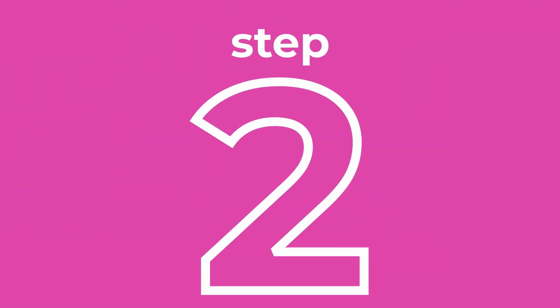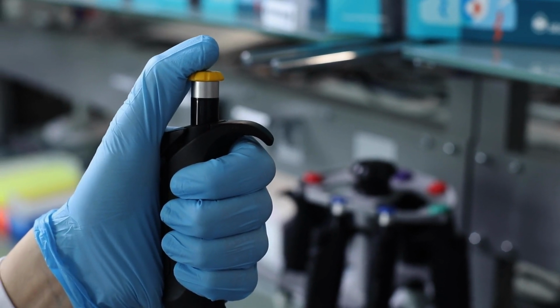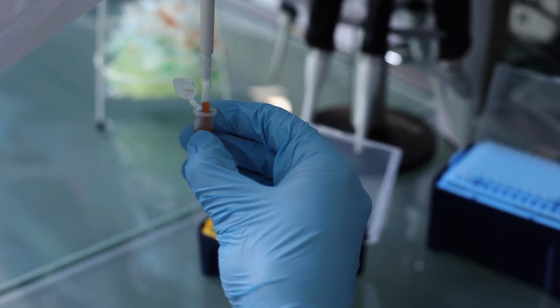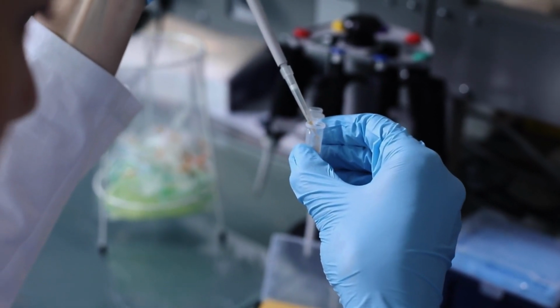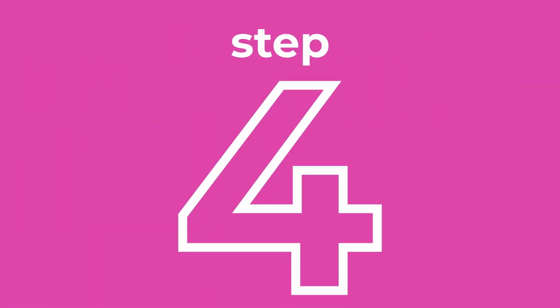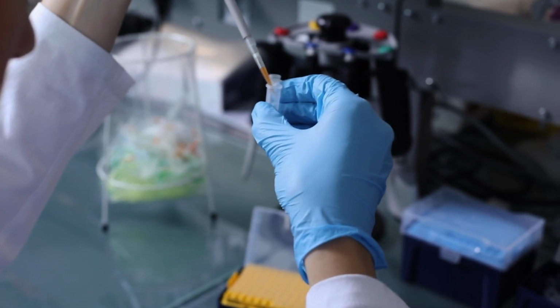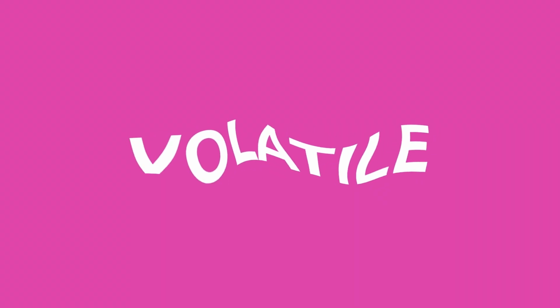Hold the pipette tip vertically and depress the plunger to the second stop. Immerse the tip into the sample and allow the plunger to move slowly back to the start or rest position. Wait 1 second and remove the tip from the sample. The pipette over-aspirates the volume selected. Place the pipette tip at a 20 to 45 degree angle against the wall of the vessel and depress the plunger to the first position. The pipette tip dispenses the correct volume selected, while some of the sample is left in the tip. Allow the plunger to slowly return to the rest position. The tip can now be ejected. See, that wasn't that difficult. Just remember, for working with viscous, foamy, or volatile samples, work it and reverse it.